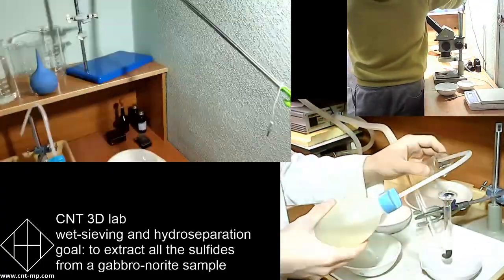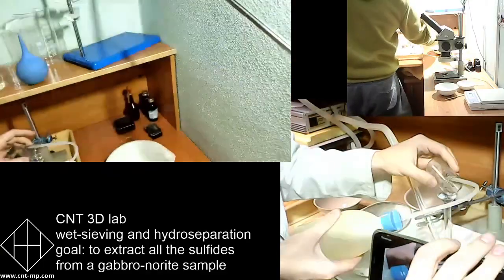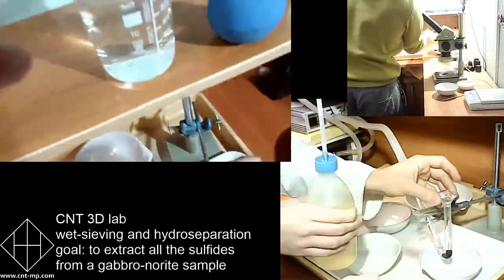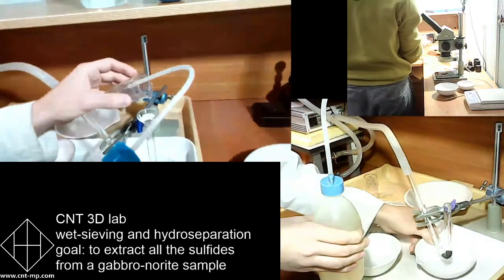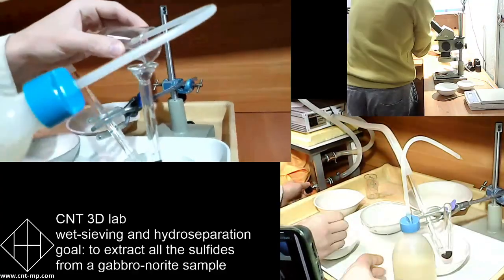This is for reconciliation of chemical balance as well. So whenever we've got mineralogy, we can recalculate all minerals to chemistry and understand all the balances. It's very important. But this time, we show you how to fill the tube.